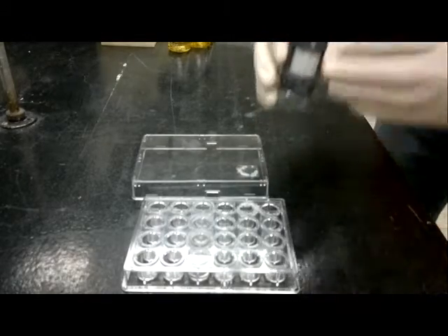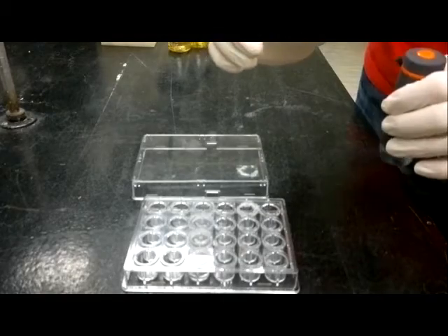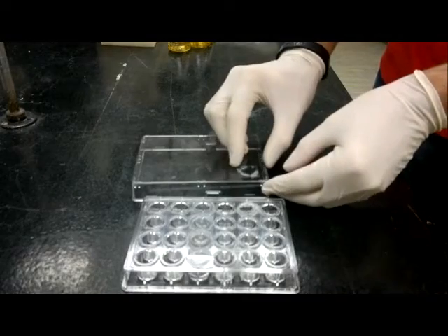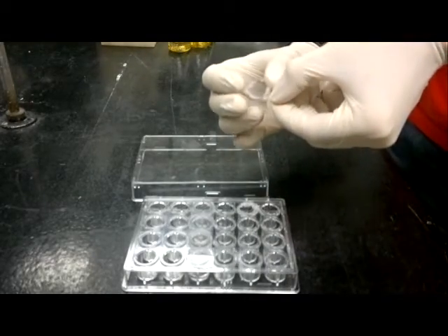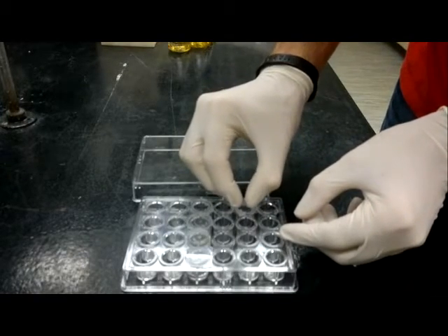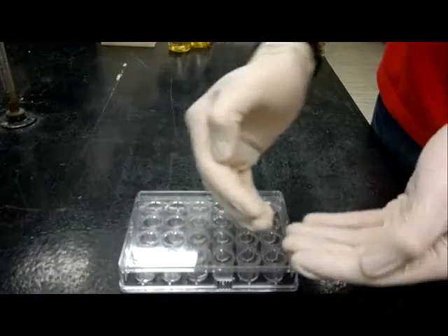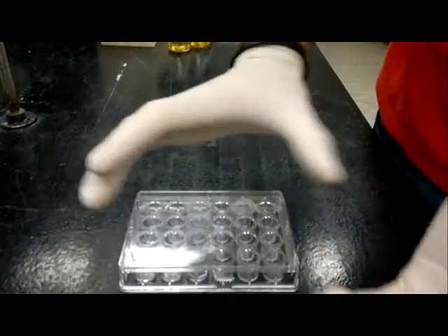At this point, if you feel you want to take pictures of this particular crystal again, after giving it some more time to grow, and some of the crystals will grow after addition of methylene blue, you can simply replace the cover slip on the appropriate well. Give it a little push to make sure that it's sealed properly. Repeat that procedure for any cover slips that you feel have protein crystals on them, and then you can set this aside and take pictures again at a second point.